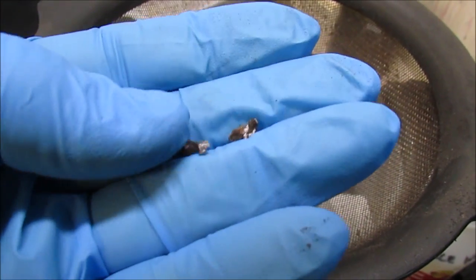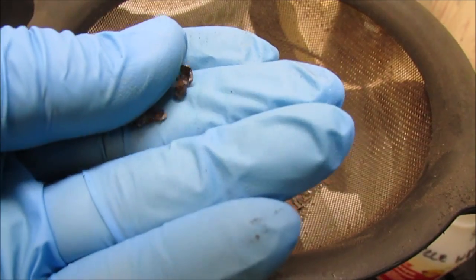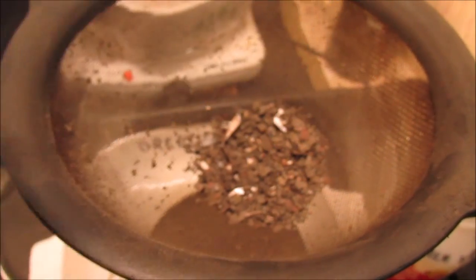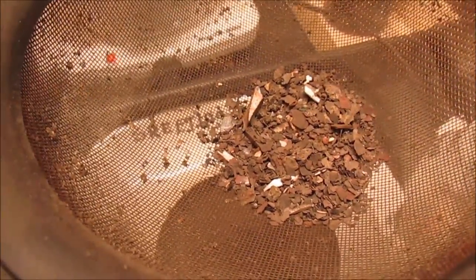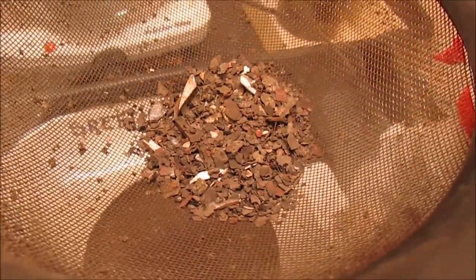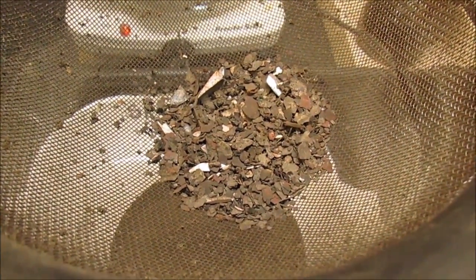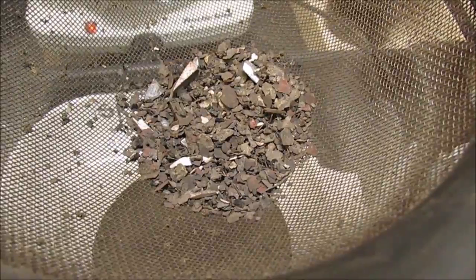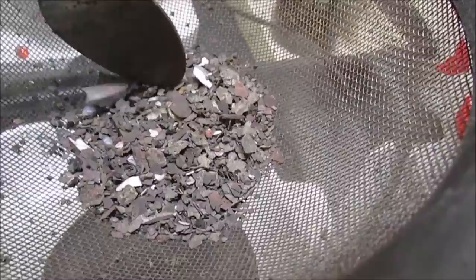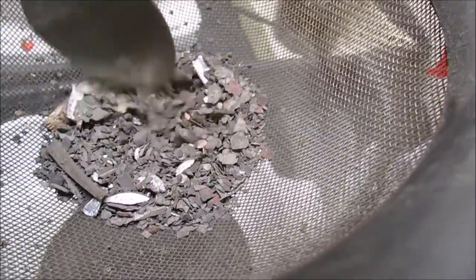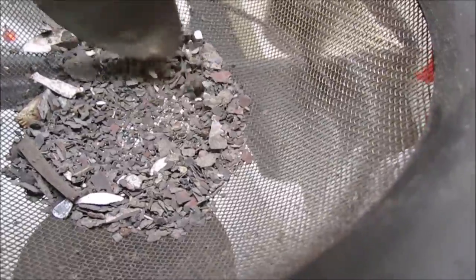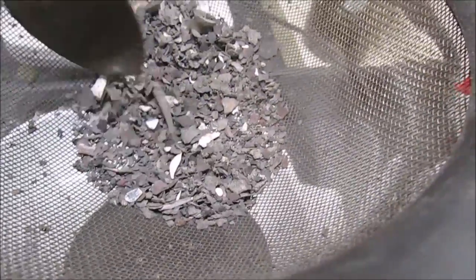These are the two little chunks of aluminum that I picked out. I don't want them in there so I picked them out of there. And I scraped the residual stuff that was in those pans into the ash, and I got a lot of scale off of the pans. And I think that's just a bunch of scale, and you can see there's some broken glass in there, just stuff we don't want going into the batch here that might cause problems.